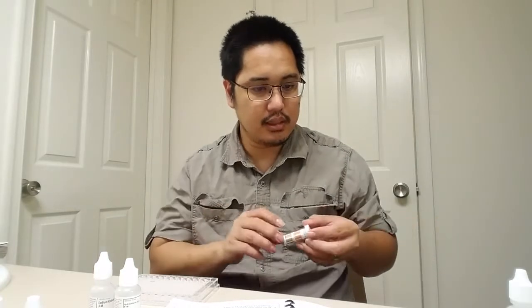What you're going to need is hydrochloric acid, sodium hydroxide, some universal indicator strips. I think that's this one. In fact, it gives you a little table, let me open this up. Don't drop these all over the place.